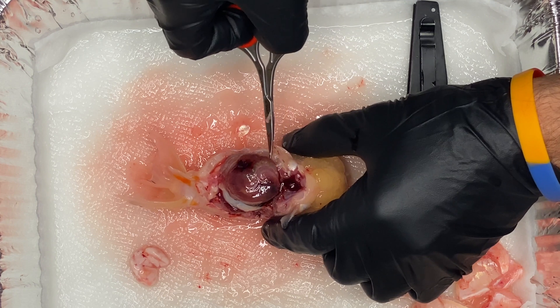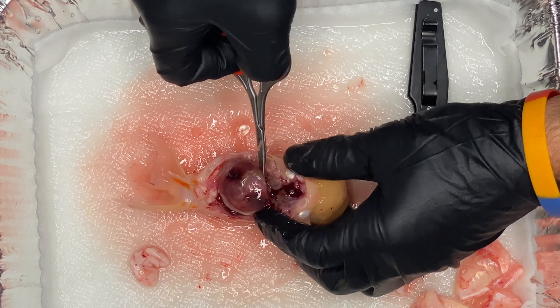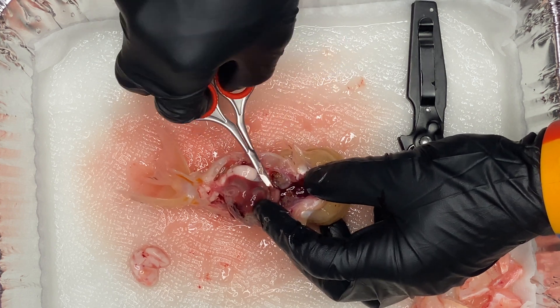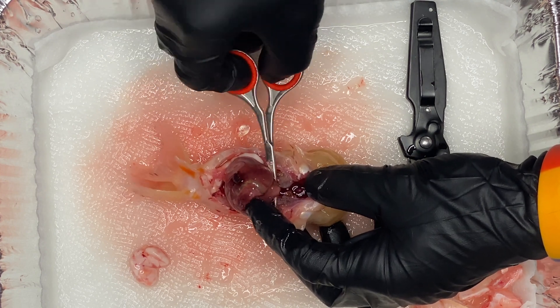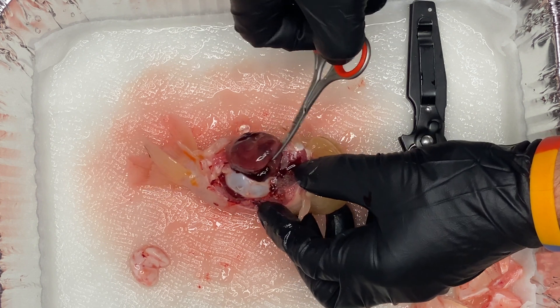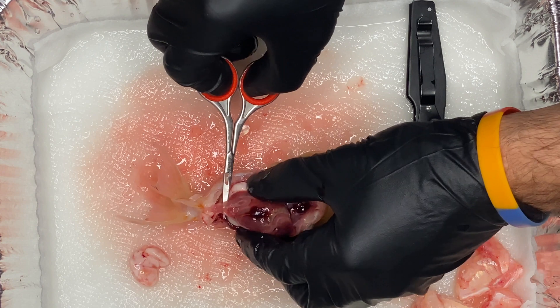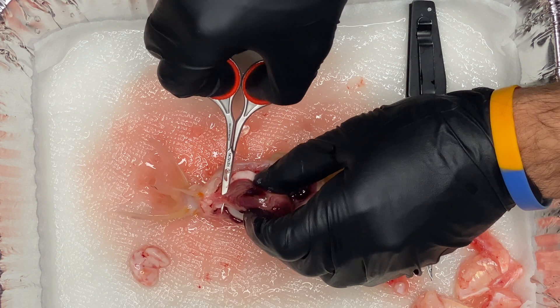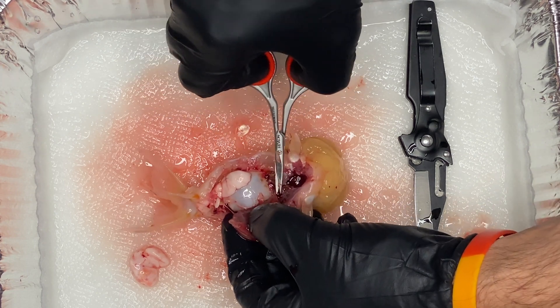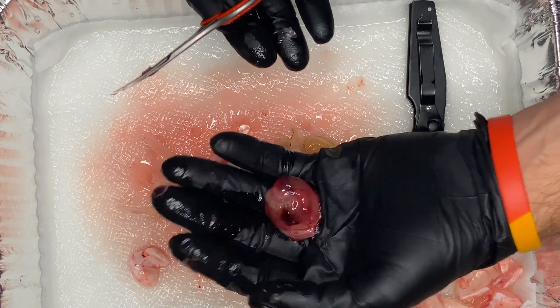After I remove the other side of the goldfish, I want to show you guys this. That little dark spot — I'm pretty sure the dark spot on the bottom of the gut there is the spleen, though I'm not 100% sure. This thing you see on the bottom of the goldfish is the gut. It connects back near where the mouth is, and once food is chopped up from their throat, it gets shoved into this little area. That's the connection point. And on the other side, that's more the liver — the liver on top of the gut. You can also see the connection to the anus. So it really has two main connection points: where they eat and where they poop. If you cut these two connection points, the entire gut basically becomes free and separated from the fish. There are some blood vessels and connective tissue that hold it, but that right there is the gut, and I'm pretty sure some of the liver is still attached.